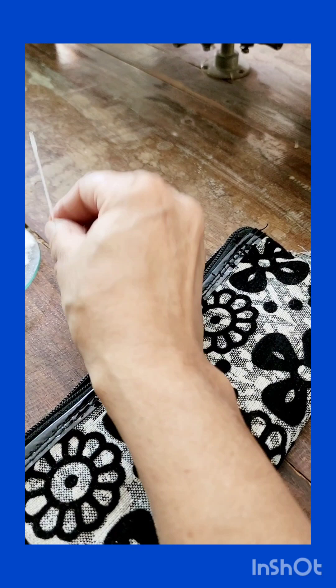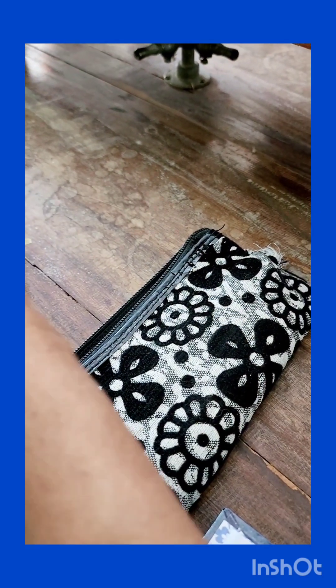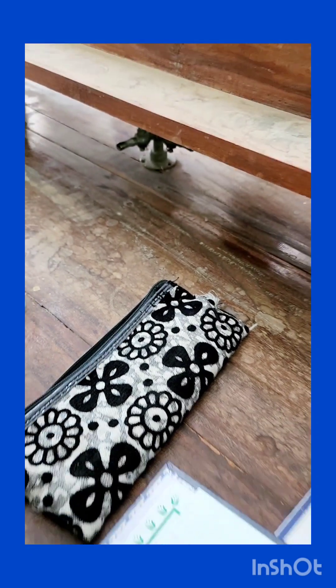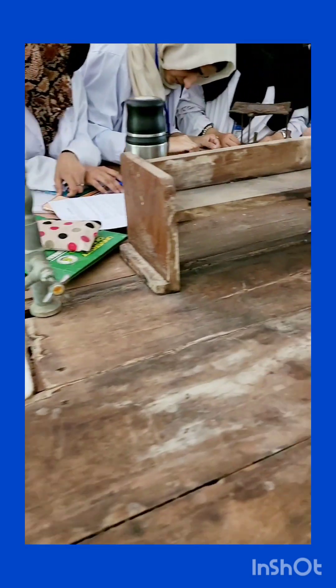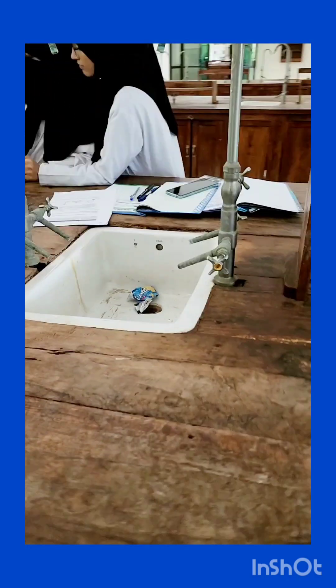It should reach the level of your thermometer bulb. Fill and tap, fill and tap on the table.